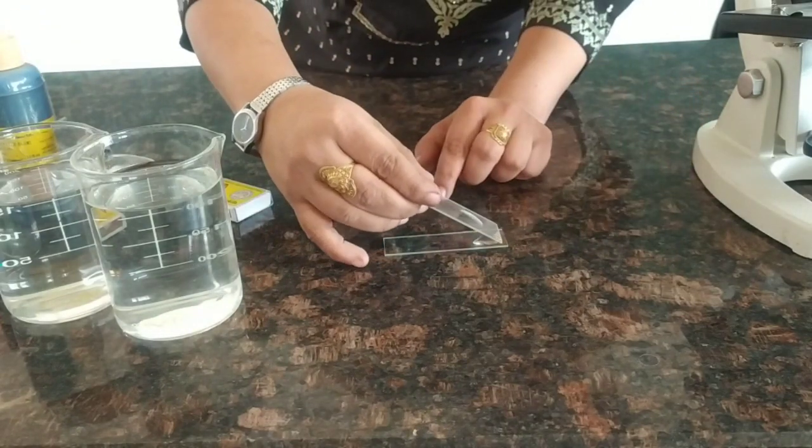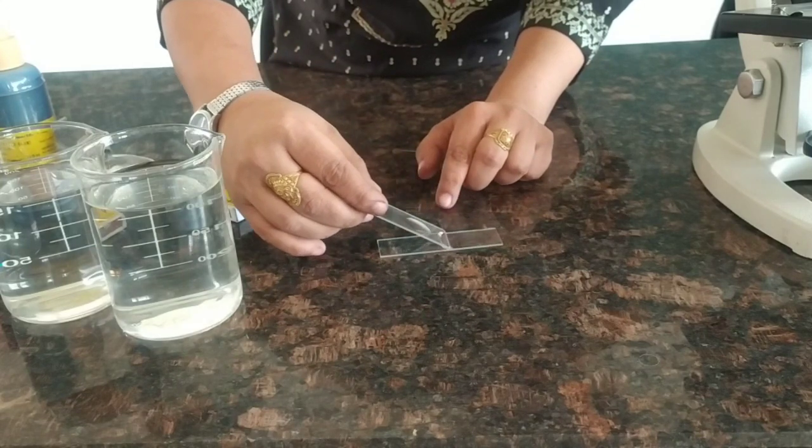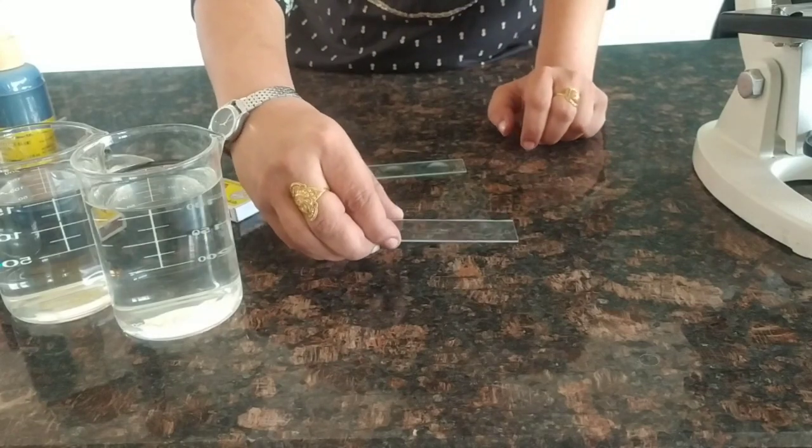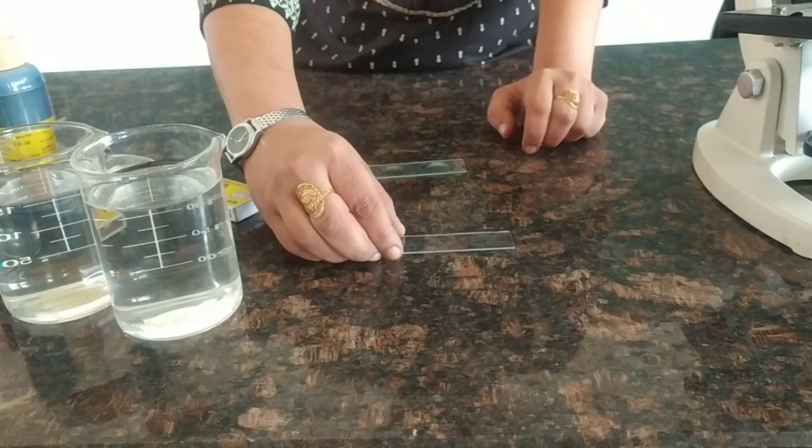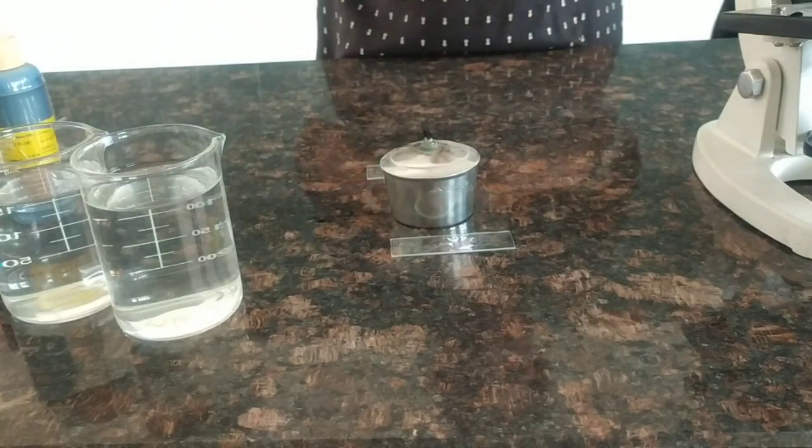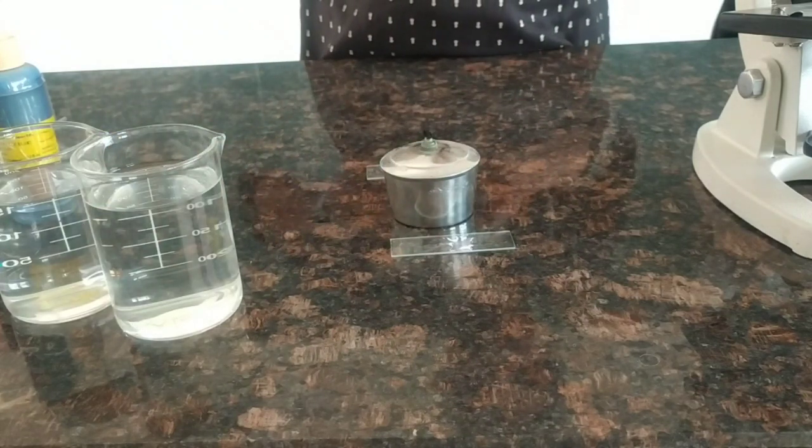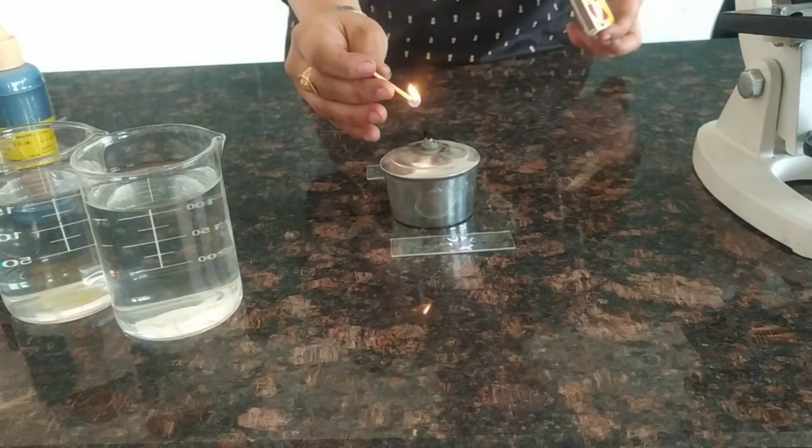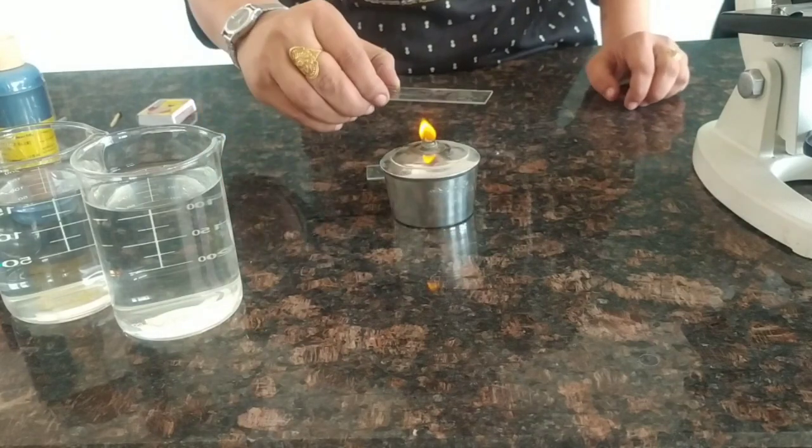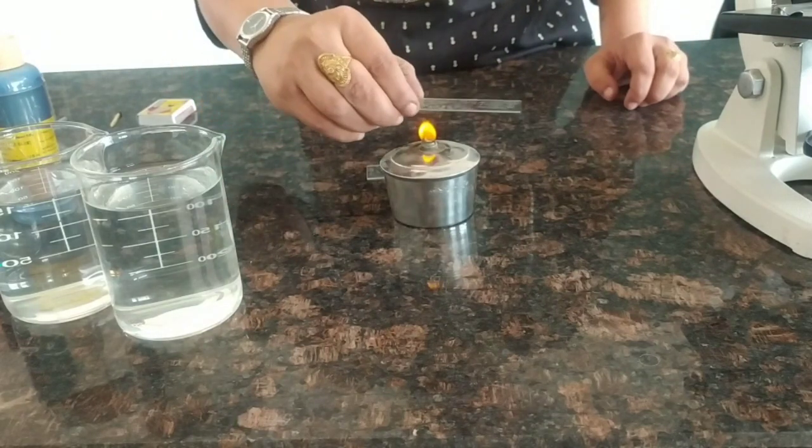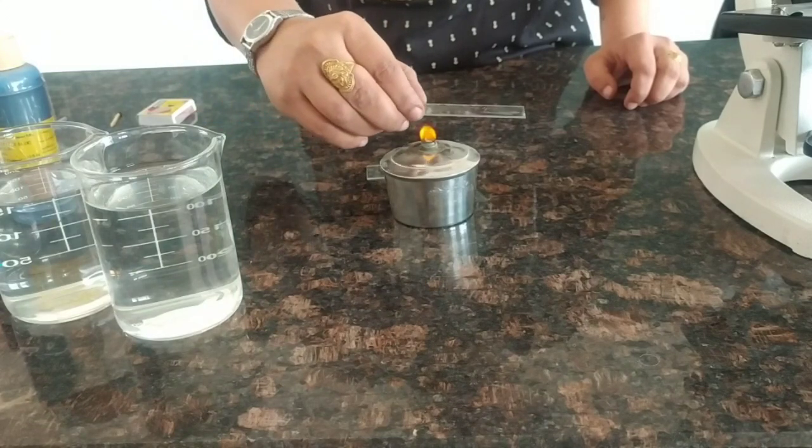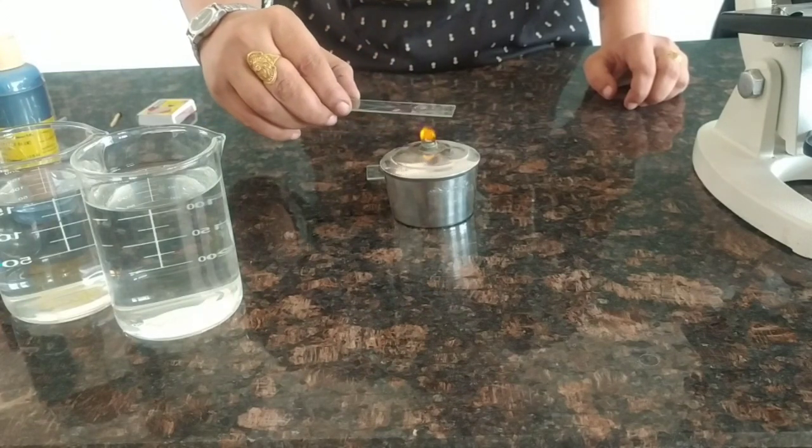With the help of another slide, make a thin film of water on the slide by spreading the water. Let it dry for some time. We can also heat the slide for drying it. Very gently we will heat the slide so that the water gets evaporated.